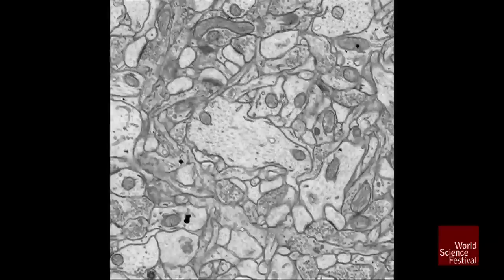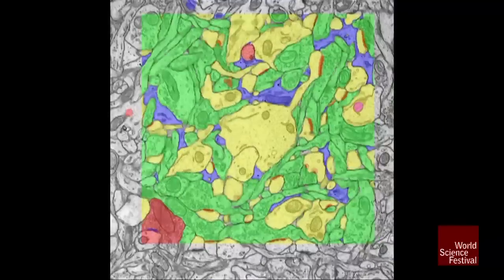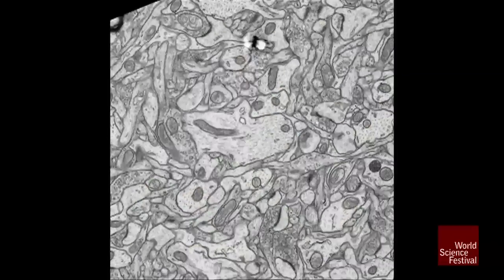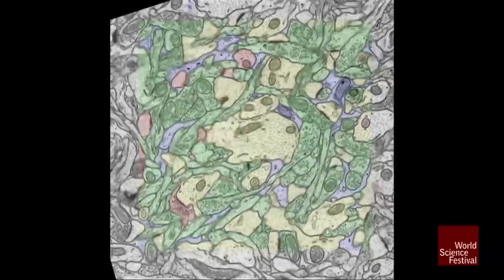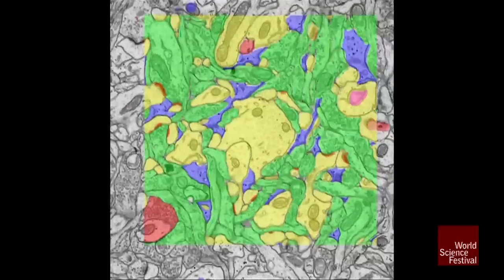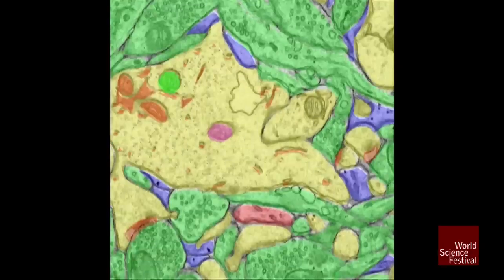So now we've jumped into the way I see this tissue when it comes off of the electron microscope. These are the electron micrographs. We're zooming in and out, and all of those structures are structures that I traced with a computer-assisted program and colorized them, named them. So there's some ground truth for these guys who are going to model the brain to know which structures are next to each other and how they interact with each other.